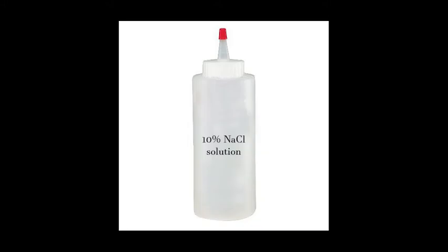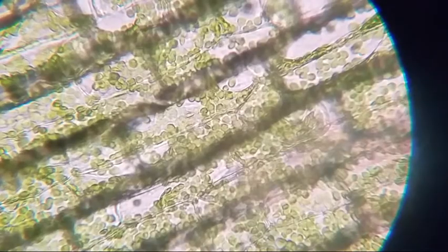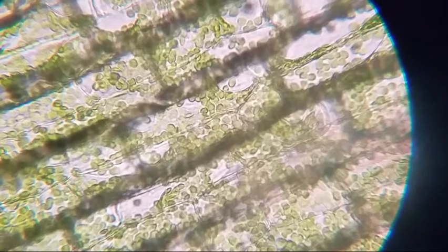Carefully place a drop of 10% sodium chloride from the dropper bottle on the edge of the cover slip of the Elodea leaf and place a piece of paper towel at the opposite edge of the cover slip. Use the scanning or low power to observe the leaf. Work your way to high power to observe the Elodea leaf.